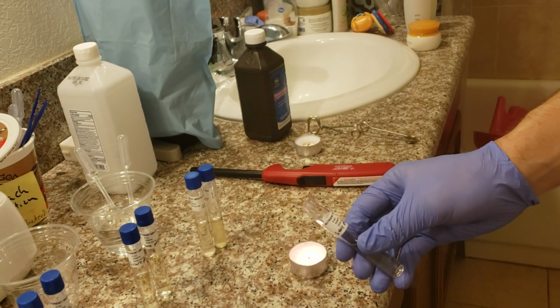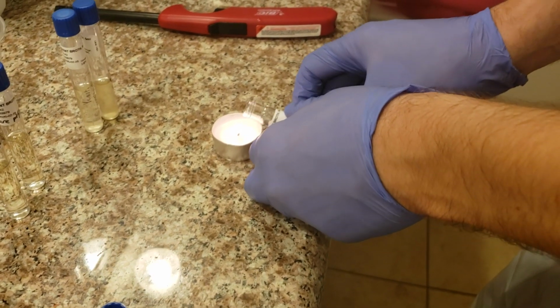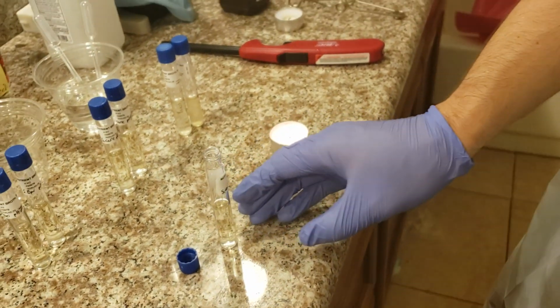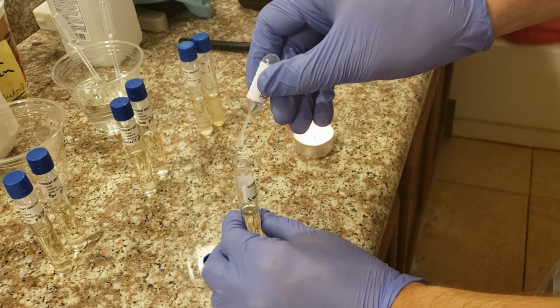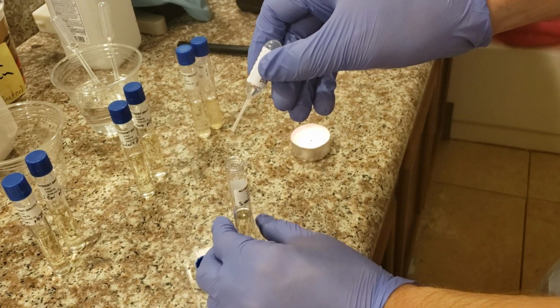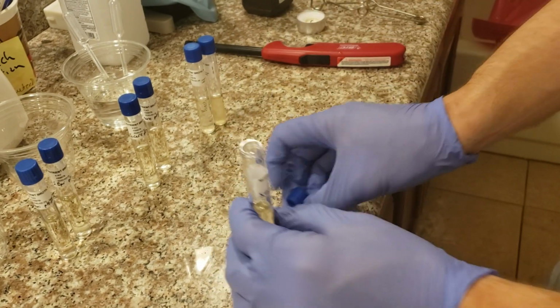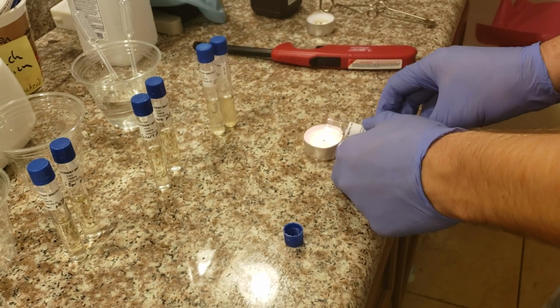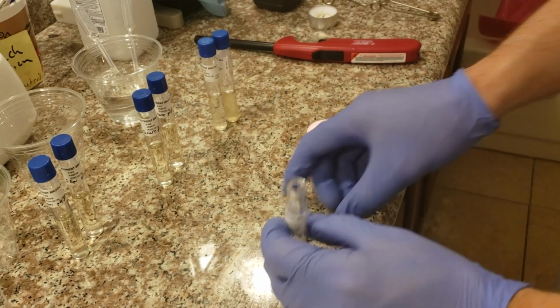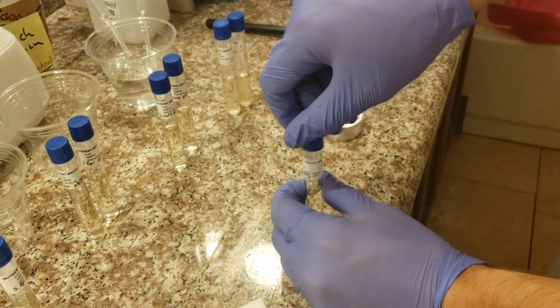Power of hydrogen 5. So we're going to pass it through the flame, of course. Brilliant. Next, we're going to take the hydrochloric acid and drop exactly 1 drop into the nutrient broth. Okay, that was exactly 1 drop. Brilliant. Next, I almost capped it off without sterilizing the lid. That would be a no-no. Okay, sterilized and reaffixed the lid. Brilliant. Hooray, we're doing science.